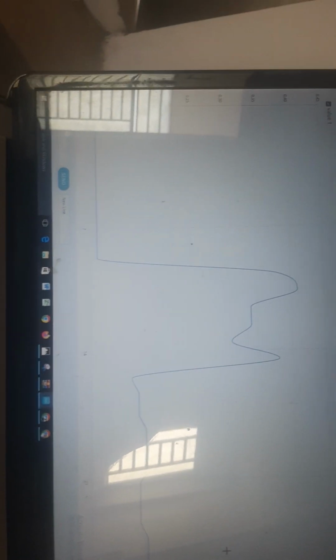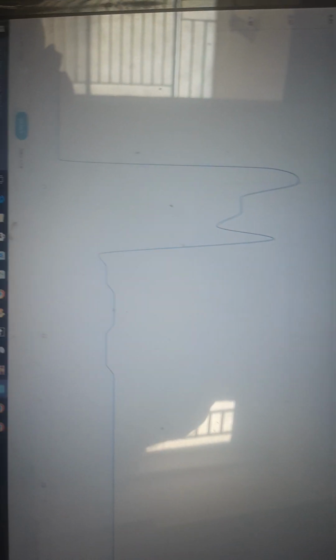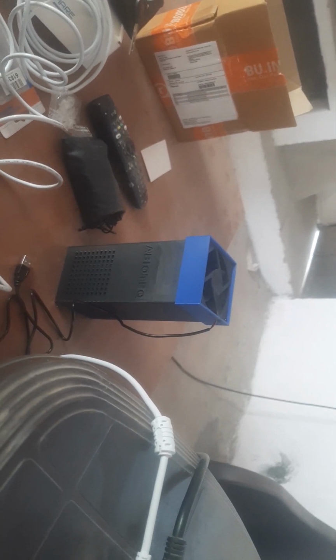Okay, so this was all about the turbidity sensor. This kind of sensor can be used in water liquid, such as even bioreactors, fermenters. And my purpose was to give a tutorial of how to use it. Now let me remove this and see how the plot drops. And let me put some kind of a paper, and it will have different kind of opaqueness, and then the plot changes much more, which means that the value is 1.2, much more than 1, which means that it's really highly opaque.